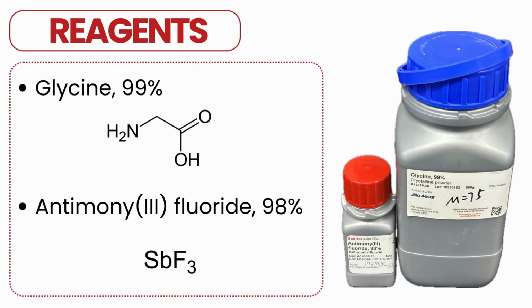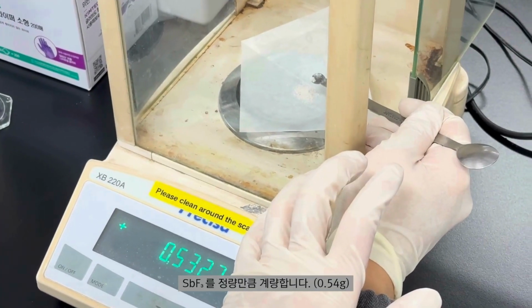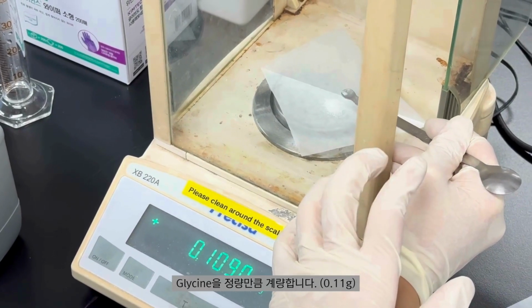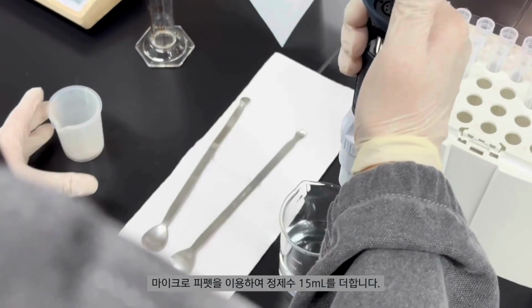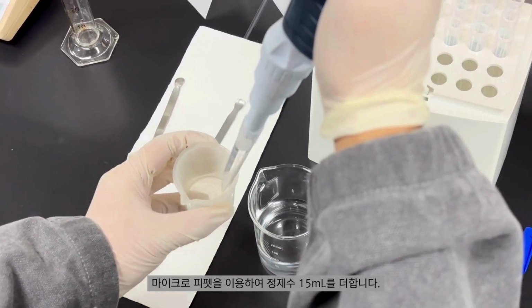The following are the reagents. Antimony fluoride and glycine were used without further purification. First, weigh out 0.54 grams of antimony fluoride. Next, we measure 0.11 grams of glycine. Using a micropipette, we add 15 milliliters of distilled water to the mixture.